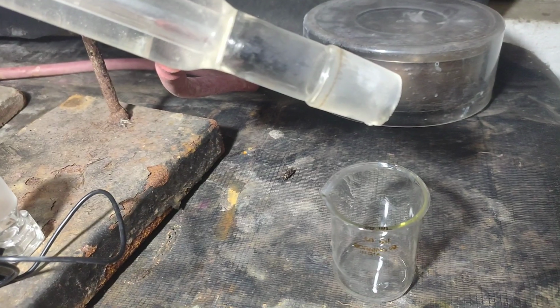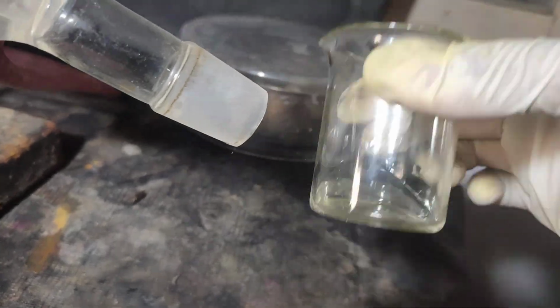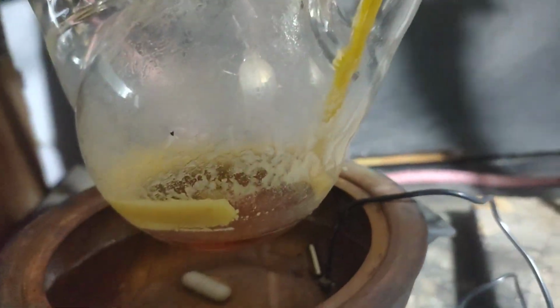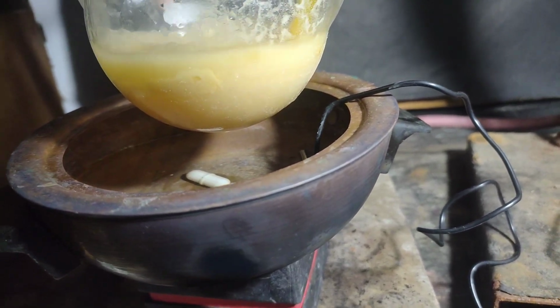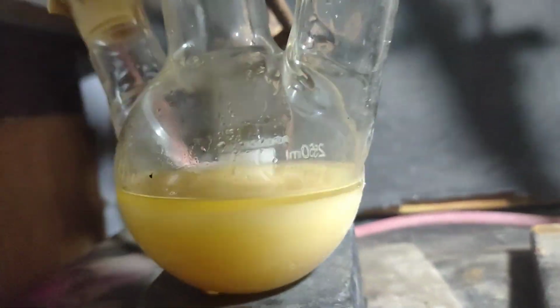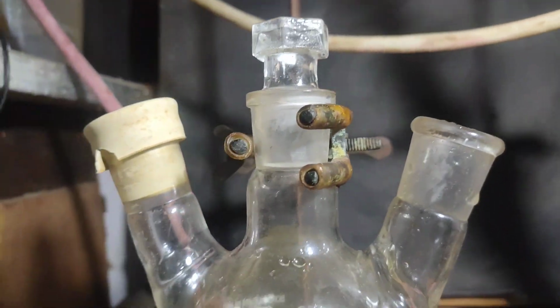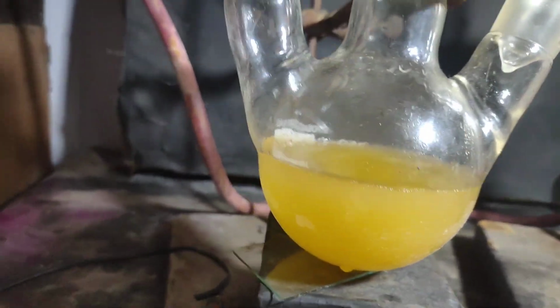Methanol was having difficulty in distilling and only this much of methanol was distilled off. So I stopped the distillation as I did not want to destroy my product due to high heat, and my vacuum pump is out of service. Then I took out the flask from the water bath and added distilled water in it and then added some petroleum ether in it. Petroleum ether would dissolve the isocyanide but not the para-toluidine.